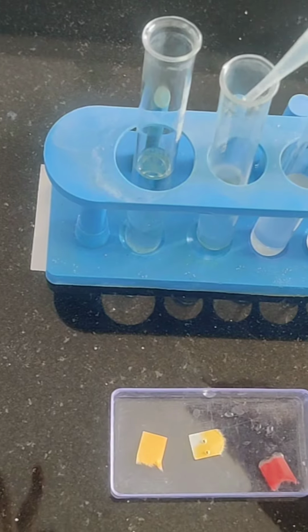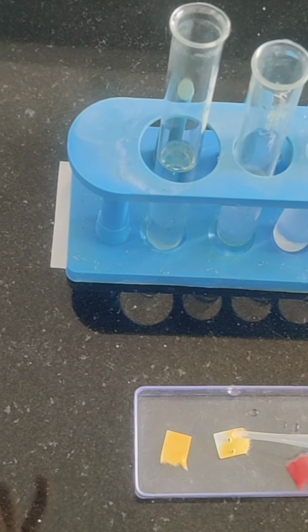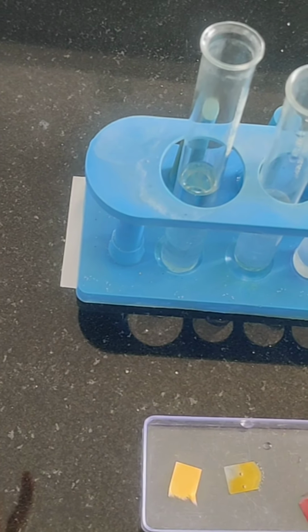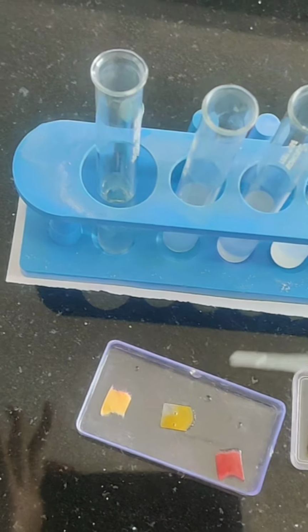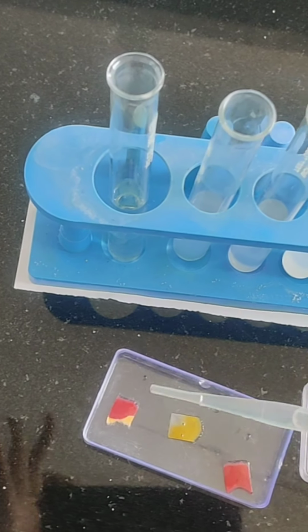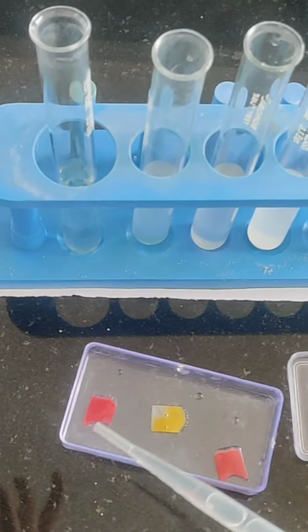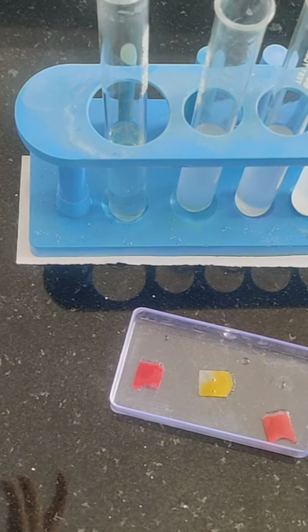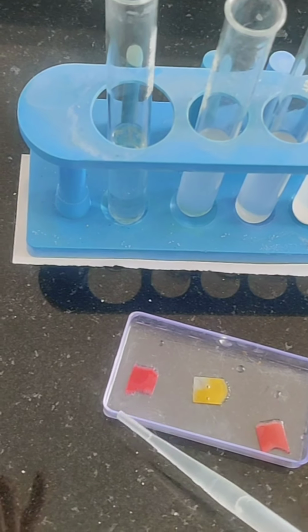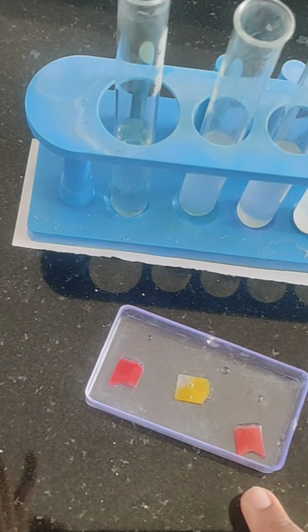We will see from the test tube fifth one. Let us check. So, this is also a basic solution. Next we will see about the last test tube, whether it changes to red or blue. So this has changed to red litmus. This indicates that this is also acidic. You can observe the difference in red color in this. This is strong, this is little bit orange, and this is little bit red compared to this one. This indicates that this is a strong acid, this is a little bit weaker acid, this is most weaker acid.